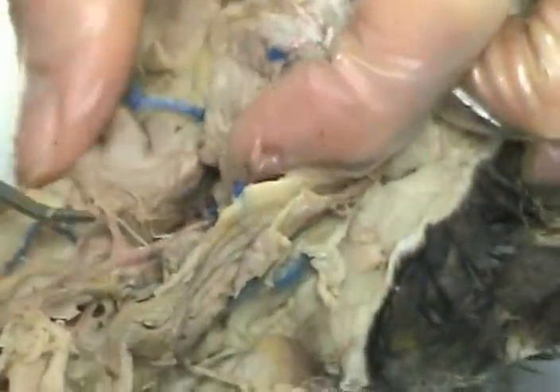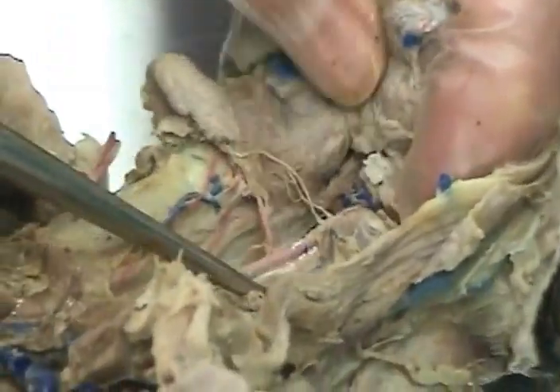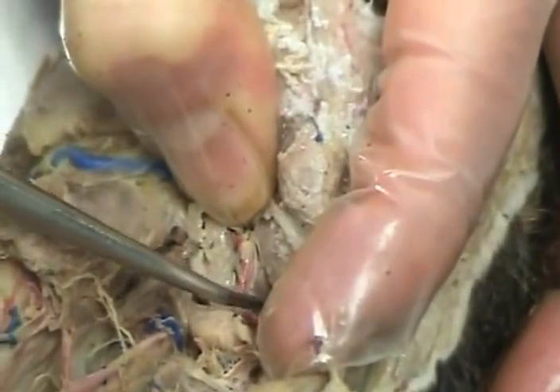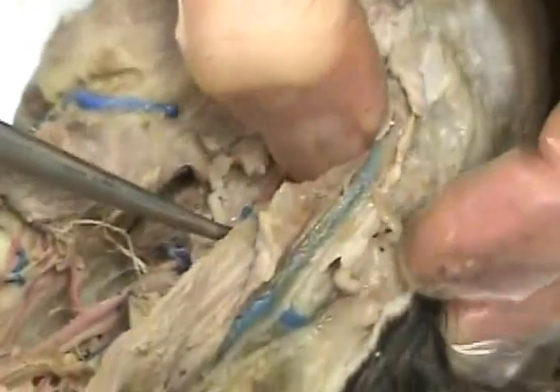And follow the neck up, the one going to the larynx is the laryngeal artery. Right behind that, going to the back of the head, is the occipital artery. This one right here that you guys cut has the nerve with it, that's the lingual artery. First branch up is the internal carotid, external carotid, and going back to the ear is posterior auricular.